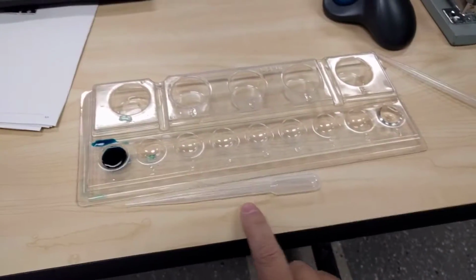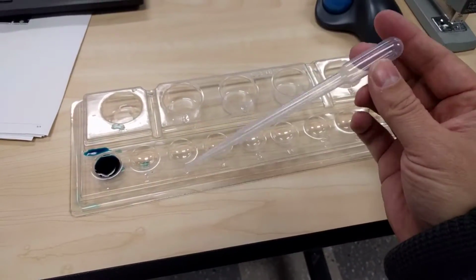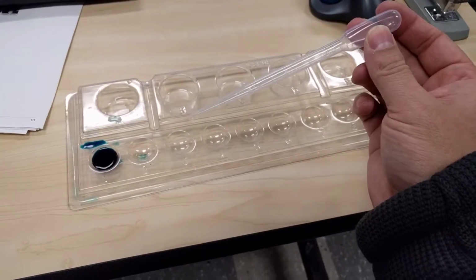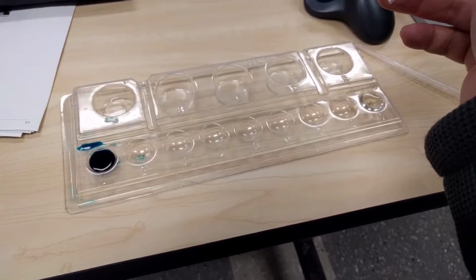All right, so what we have here is a plastic pipette. To use the plastic pipette, you can see we just have the bulb that we squeeze, okay? And this is where people will always make their mistake. We only squeeze the bulb a tiny amount, not all the way in, because we're trying to just get water right into the tip, okay?